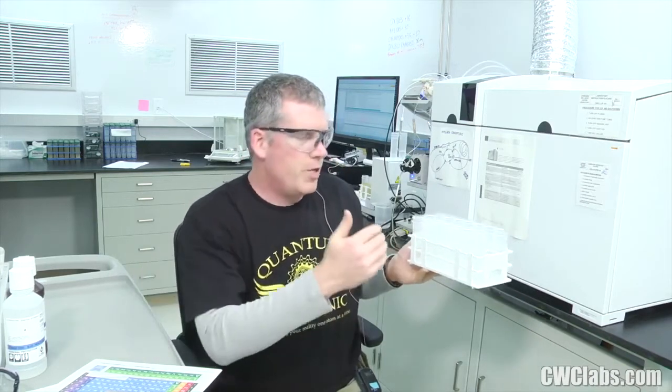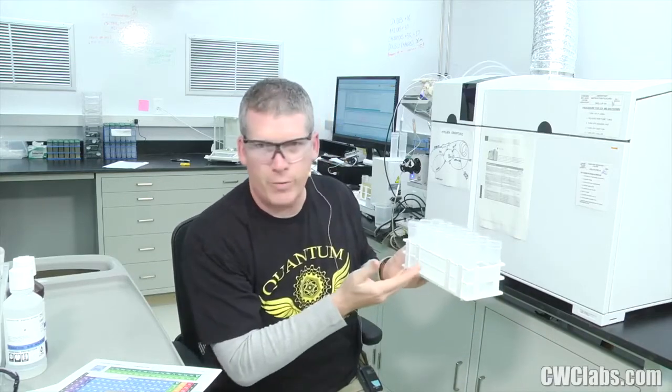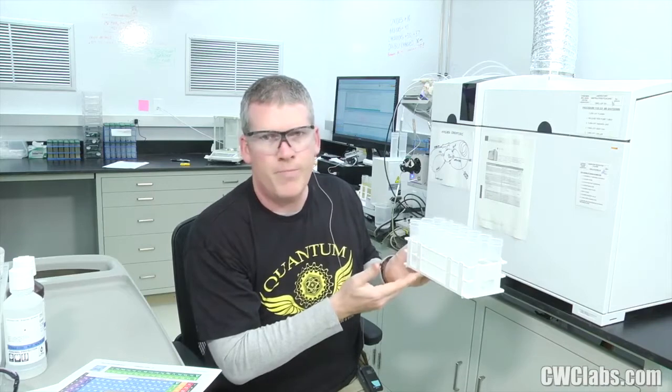If it does not, this is one good way to check the consistency of the instrument and the integrity of your curve. If you're seeing very different numbers on the unknown samples side, even though they're the same solutions as your calibration standards, then you have a big issue, and depending on the pattern, you have to look in lots of different places to find out why that is, what's happening.